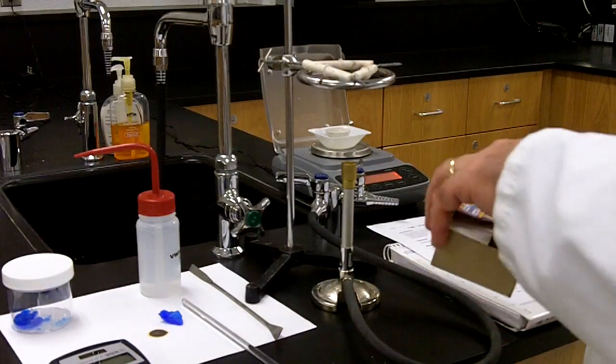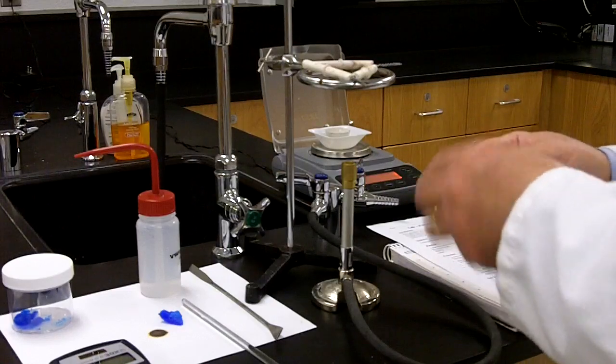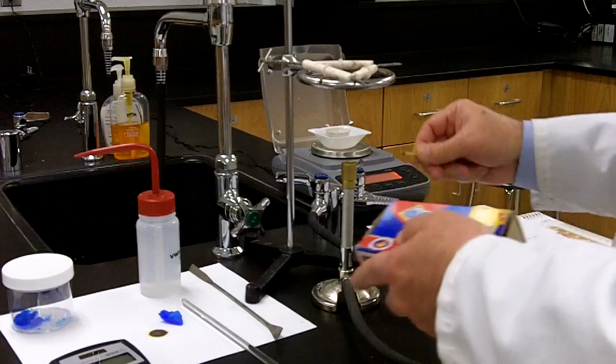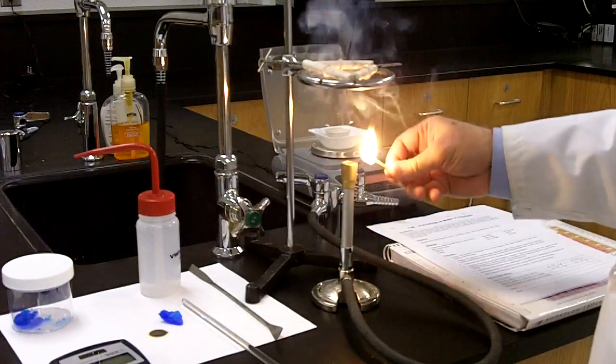So we'll just take a match and start our Bunsen burner. Remember, when you light the Bunsen burner, you always start the match first, just like that.